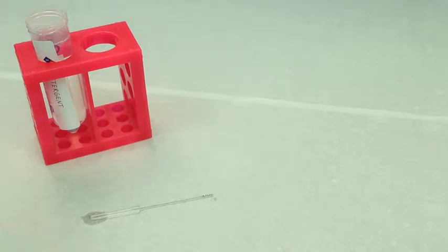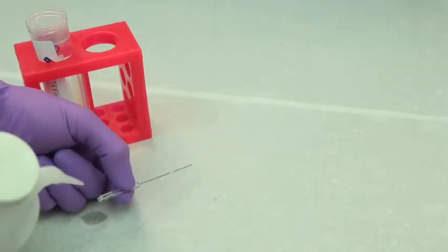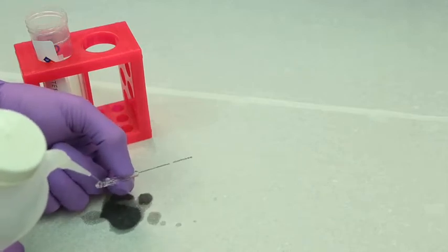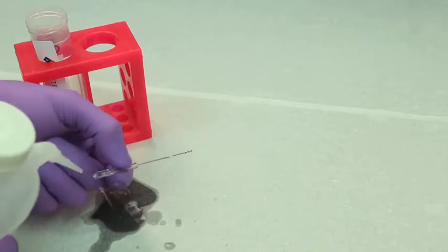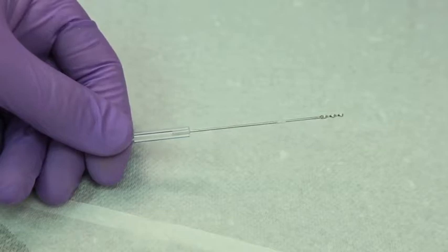Finally, give the glass syringe a thorough rinse with water to remove as much detergent as possible. Drying the syringe prevents sample dilution and the user may choose to dry it themselves before reinstallation or to perform a cleaning operation using the instrument.